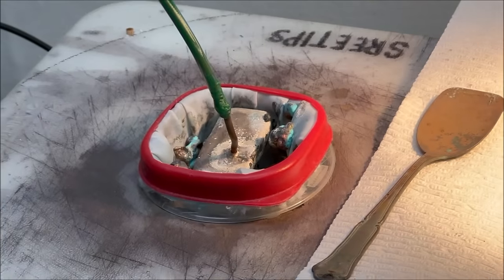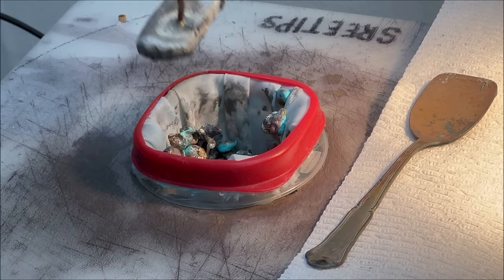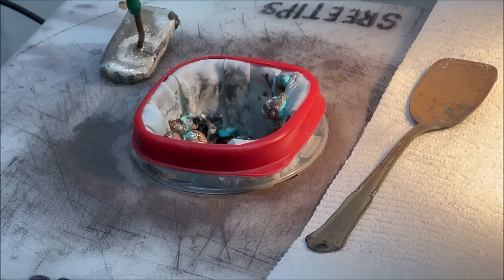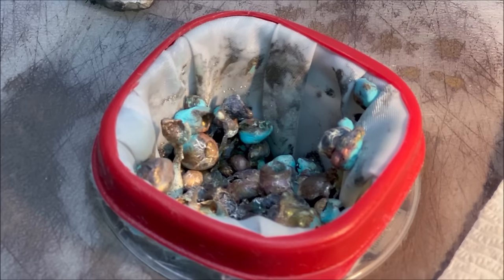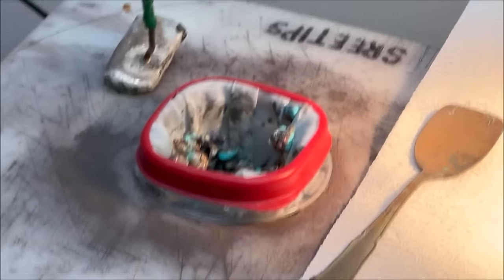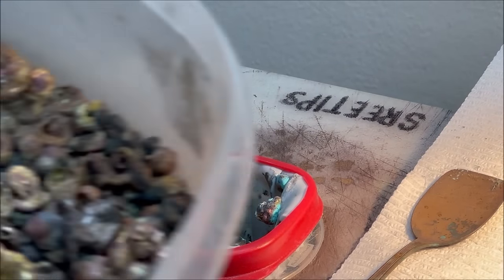Now what we're going to do is add some silver to this. I just pull out the anode electrode bar. You can see down in there all the silver's been consumed by the electrolytic action. That was full yesterday when we started the cell up. So today what I'm going to do is refill the anode filter with some of our impure silver.